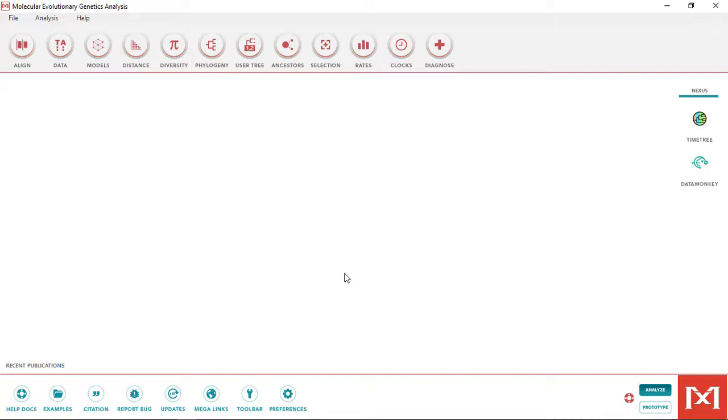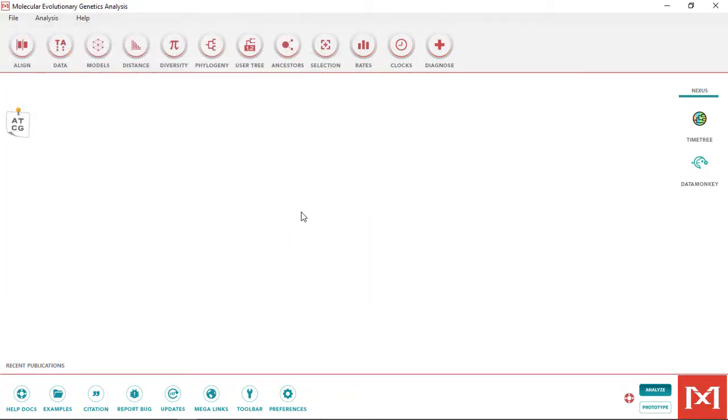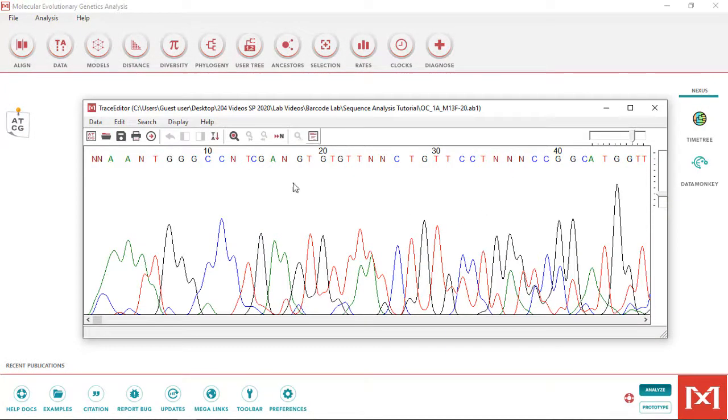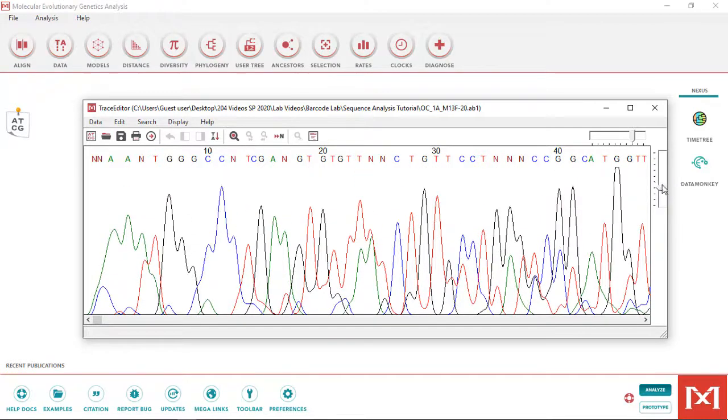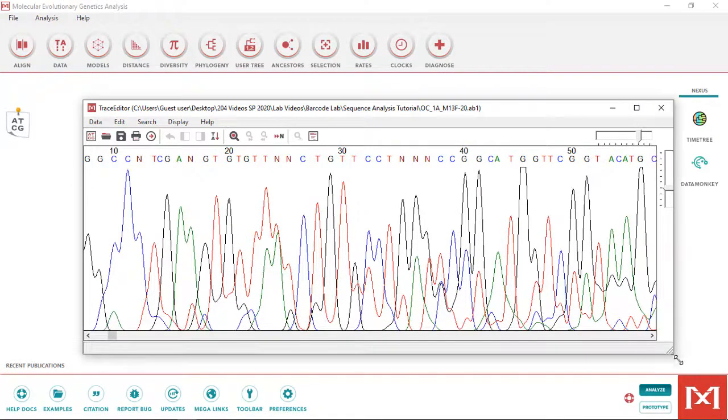Open up the MEGA program, go to Align, then Edit View Sequencing Files Trace and find the .ab1 file you saved to your computer. This should open up the trace file in a new trace editor window like you see here. You can resize the window and use the slider up here to change the zoom and wave height of the electropherogram so it's easier to view.